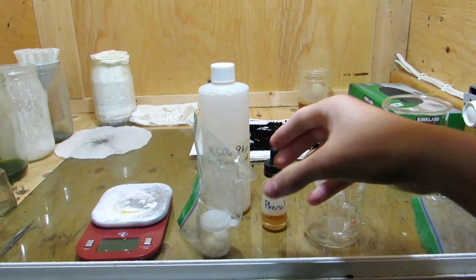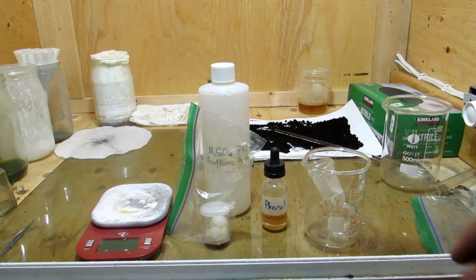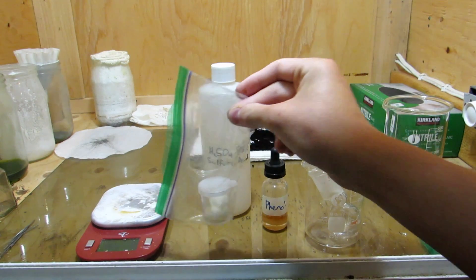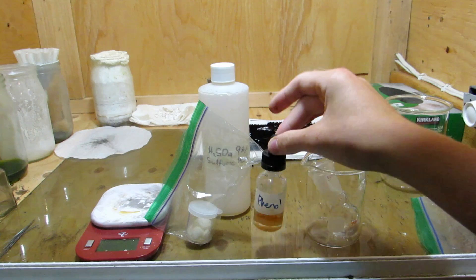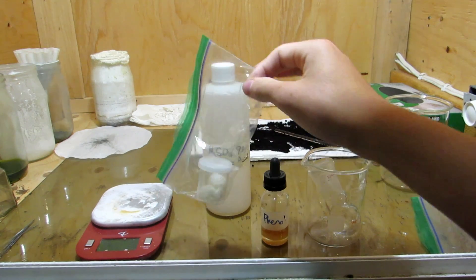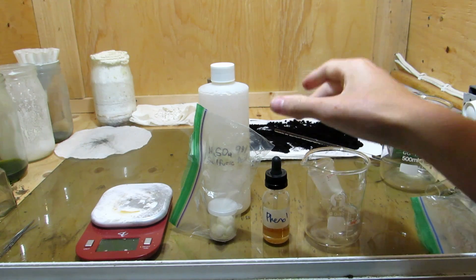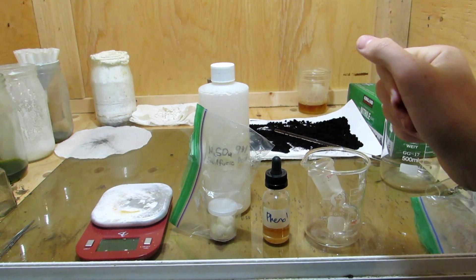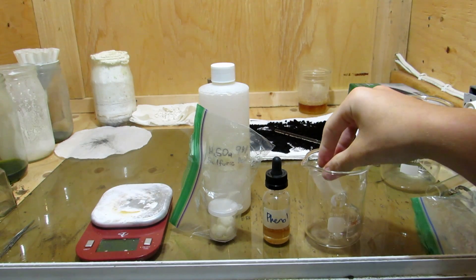That's a very condensed version of what actually happened — you'll have to watch the other videos to see how this 0.58 grams of phthalic anhydride was made, but it was definitely not easy. Based on 0.58 grams of phthalic anhydride, stoichiometrically we would need 0.75 grams of phenol. However, there are impurities and we want to make sure all of our phthalic anhydride reacts, and we can remove excess phenol in a purification step. So I'm adding one full gram of phenol and all 0.58 grams of phthalic anhydride, which should ensure a good yield.